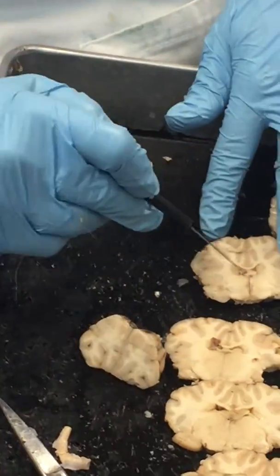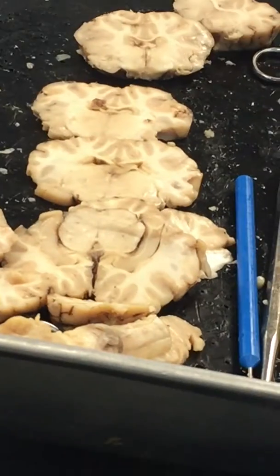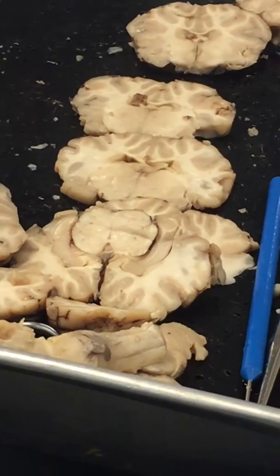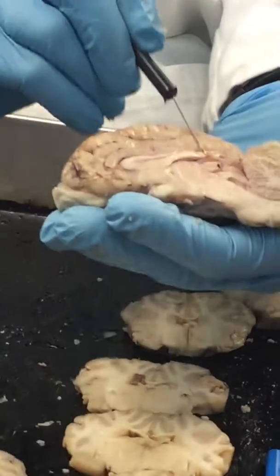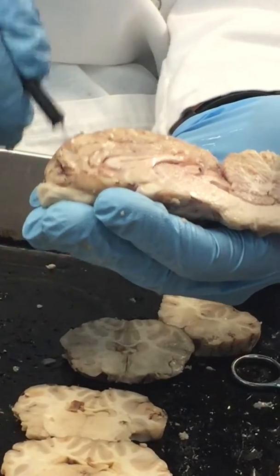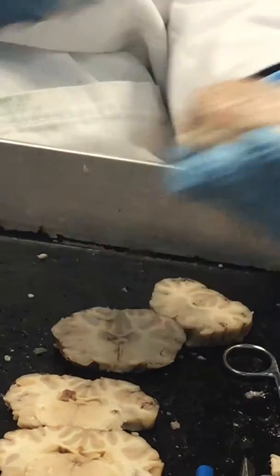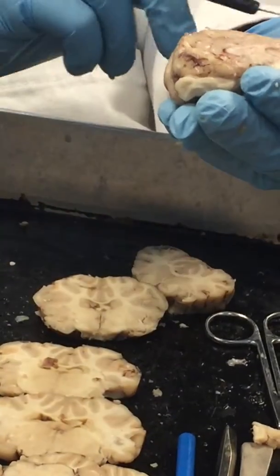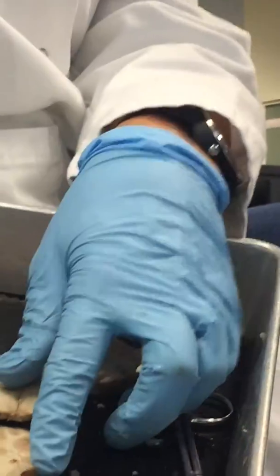And that corpus callosum is running all the way through, because when we look at the sagittal section, we see it, right? Kind of this big band. This is that corpus callosum, this big band kind of going all the way through. So we make a couple cross sections here, we don't see it, and then all of a sudden we're getting it. And then we're going to get it all the way down, you know, close to that midbrain here, okay? So that's what we can see there.